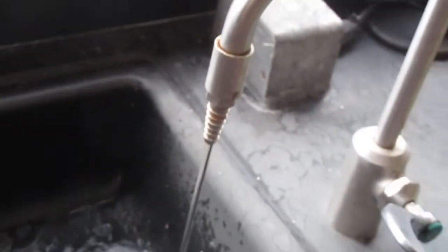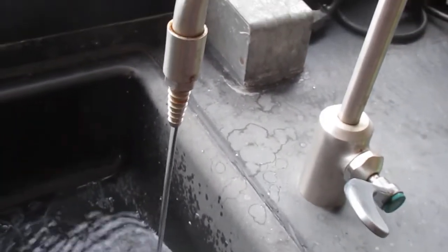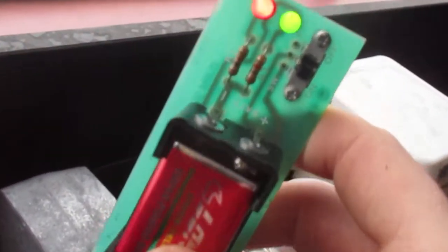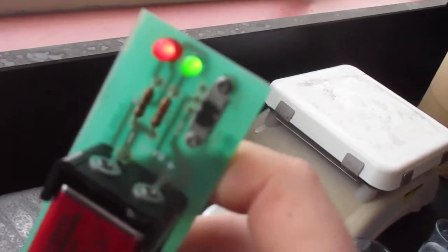There's other stuff in this water that's allowing it to work. As you know, metals conduct electricity.